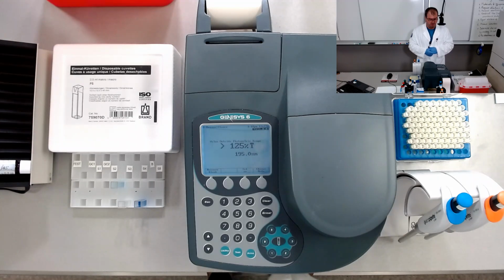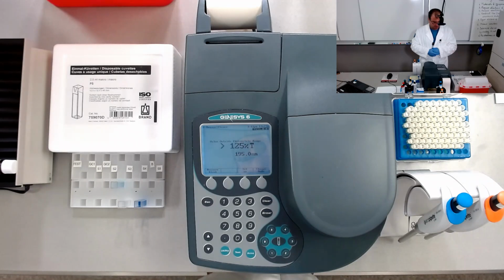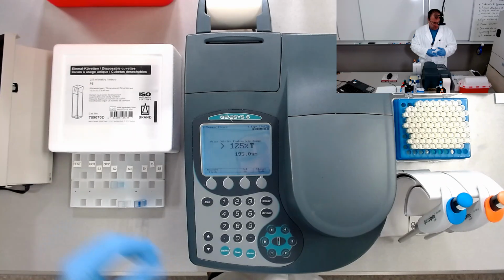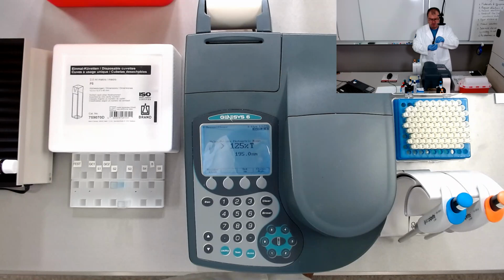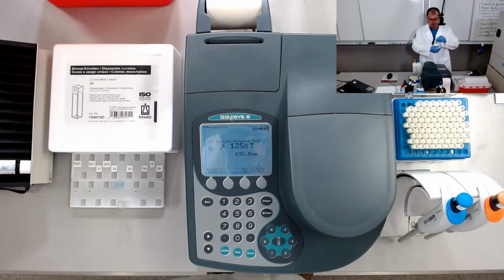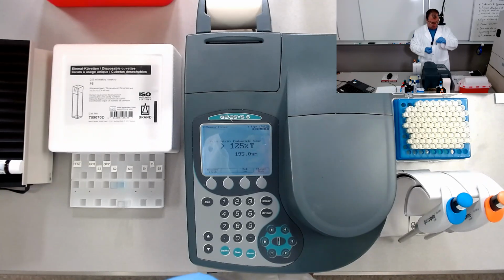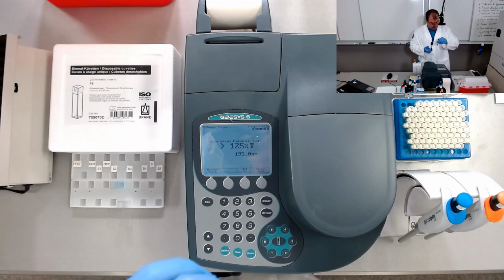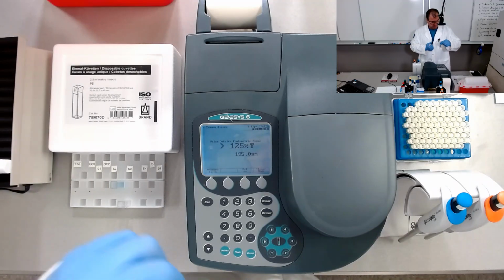Hi, I'm Costel. In this video I'm going to show you how I collect an absorption spectrum using a Genesys 6 spectrophotometer of a sample consisting of total protein reagent and control serum in a proportion that is indicated by the manufacturers. 1 to 50 is the ratio between serum and reagent. So we are going to obtain the absorption spectrum of this sample.